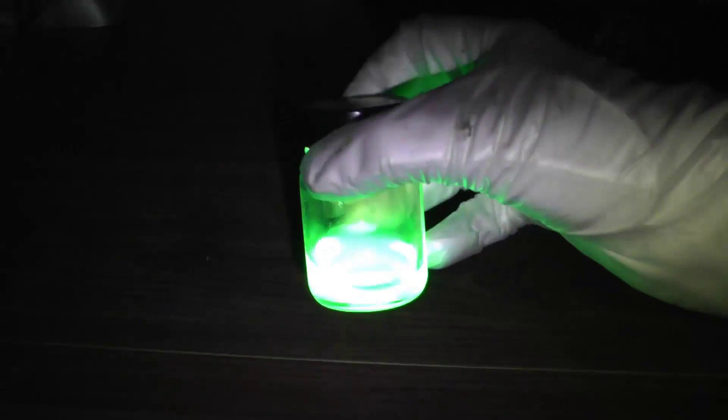Sup nerds and nerdettes. Today I'm going to show you how to make a real glow stick with chemicals.